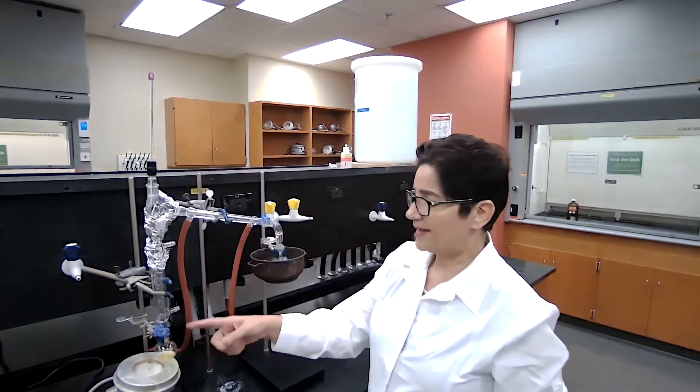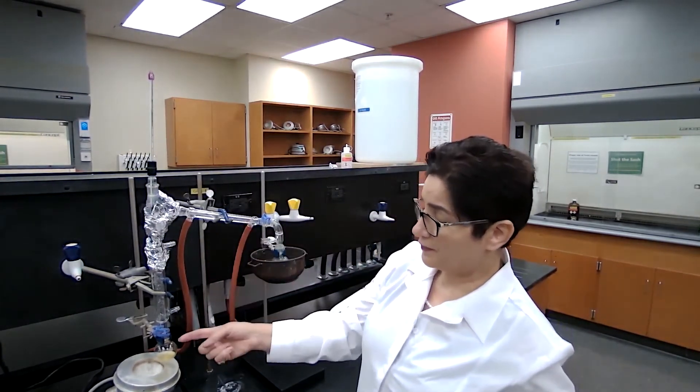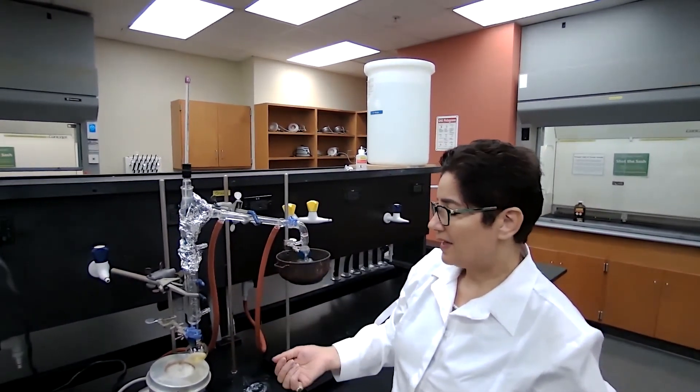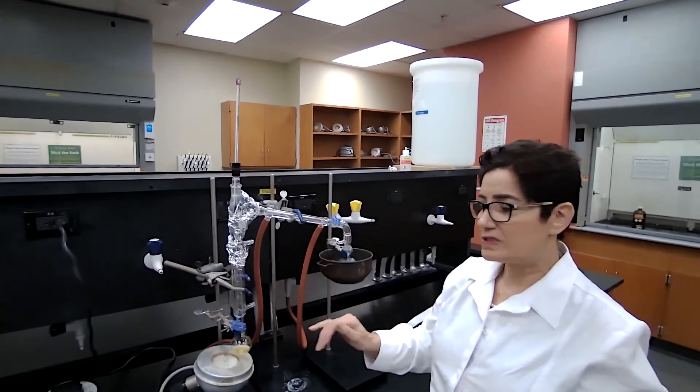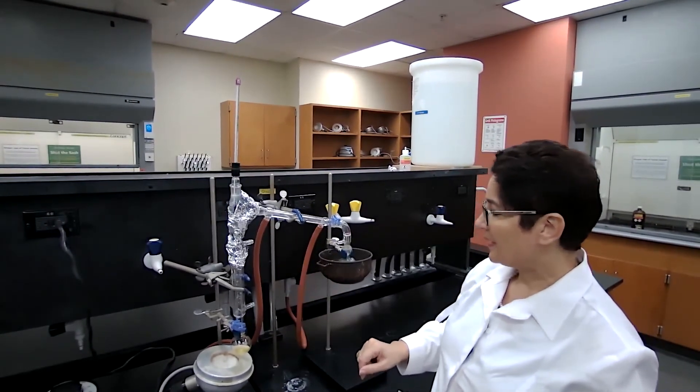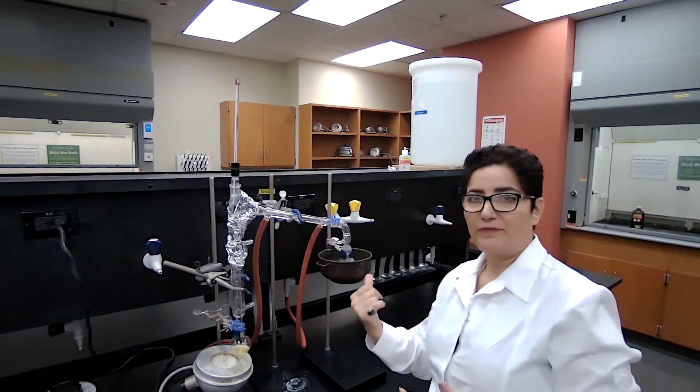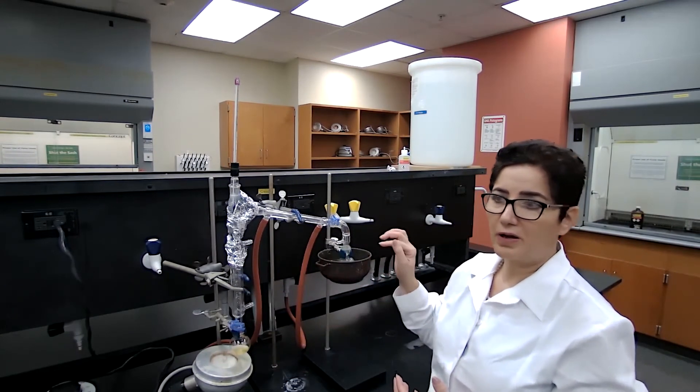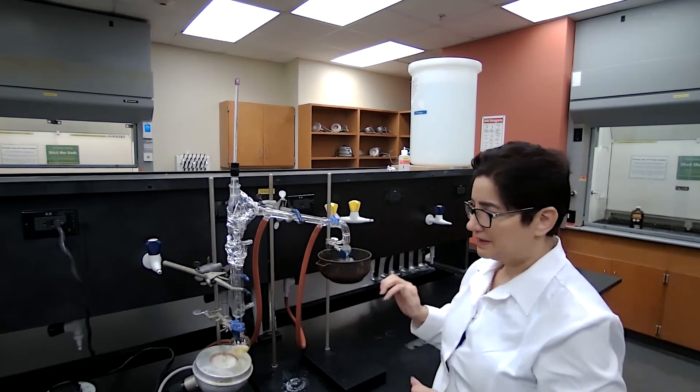If we saw a fume inside the flask, like a cloud forming, that's basically acid vaporizing. In that case also, we're going to stop the distillation. But we still have liquid, and since we have the 10 milliliter mark, we are stopping the distillation.